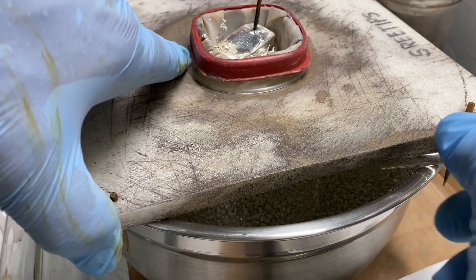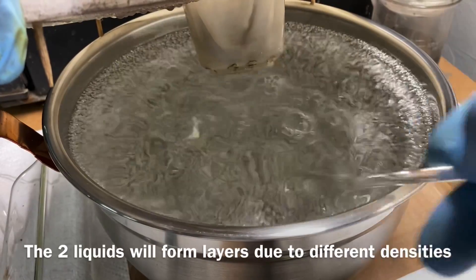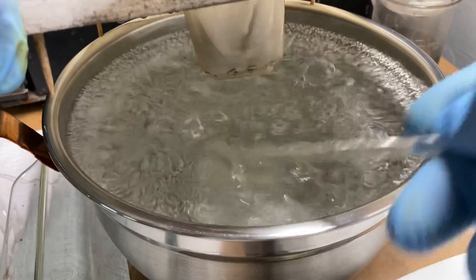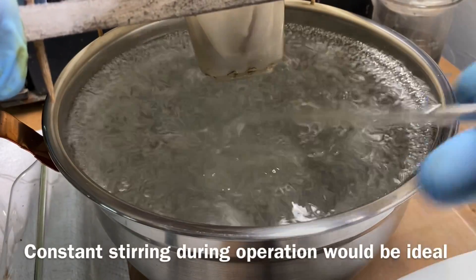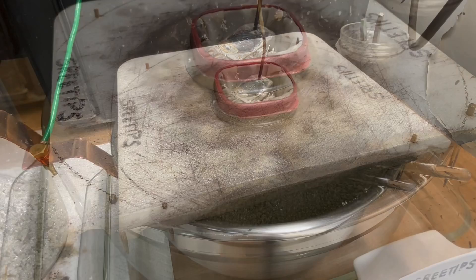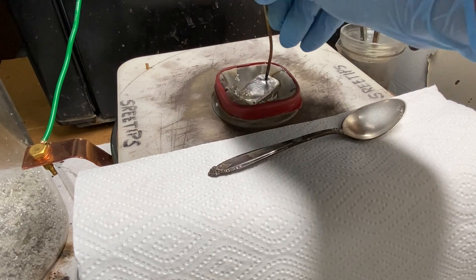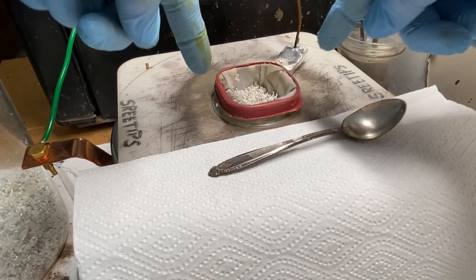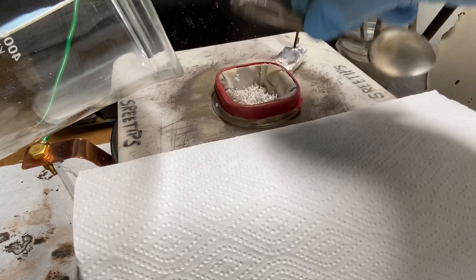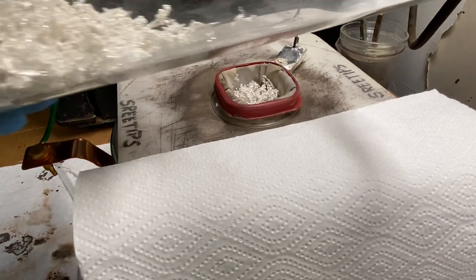Now I want to stir this up and carefully mix the freshly added electrolyte with the electrolyte that was already in the bowl. Now I'll cover the cell opening here so we don't drop anything down in there. What we're doing is feeding pure silver crystal back through the cell a third time, so I'm going to recharge the anode filter basket with more pure silver crystal from a previous refining.